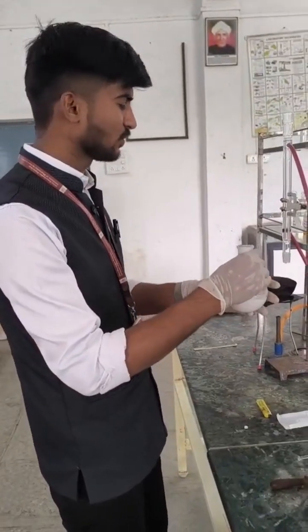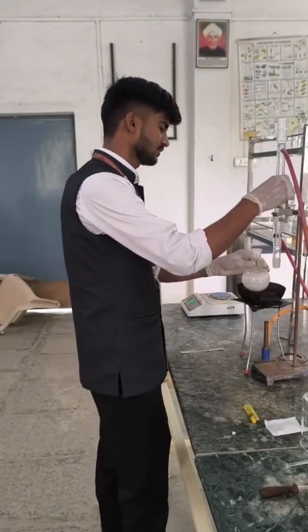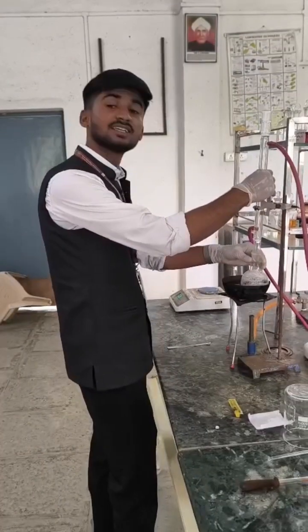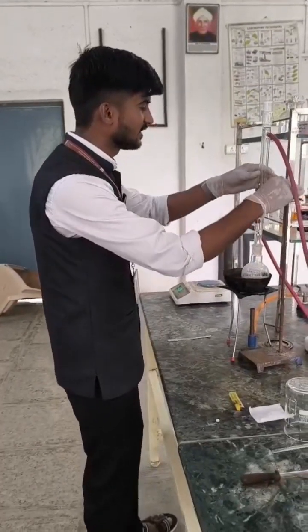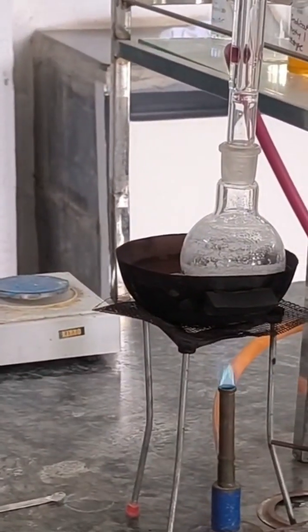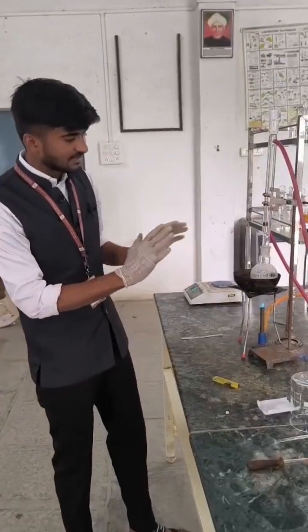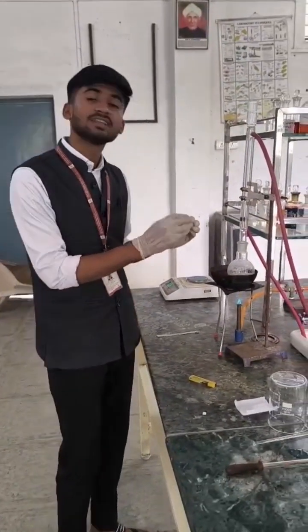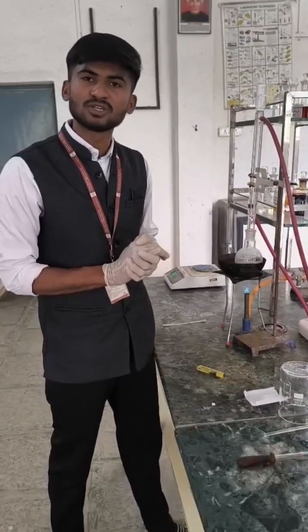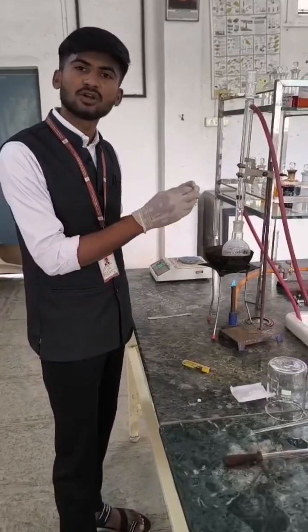Now we are going to fit this round bottom flask with the reflux condenser. The round bottom flask is fitted with the reflux condenser and we heat it for 30 minutes. During this heating, the benzamide reacts with the 10% sodium hydroxide solution, resulting in the formation of sodium benzoate.